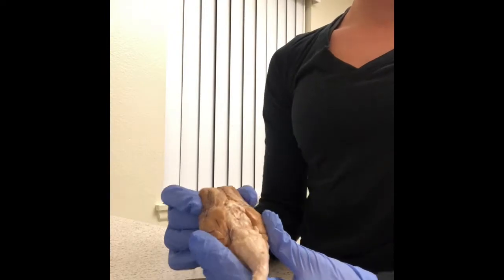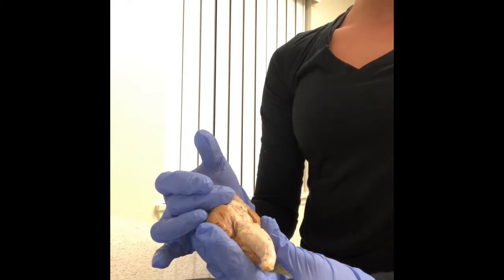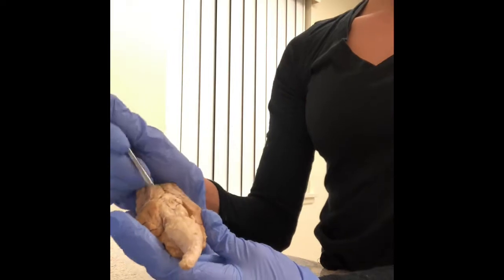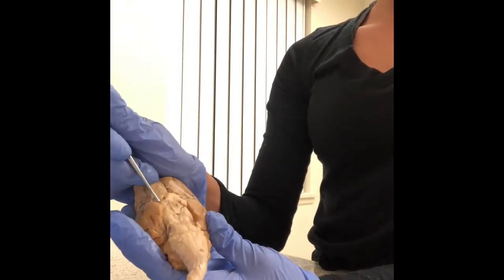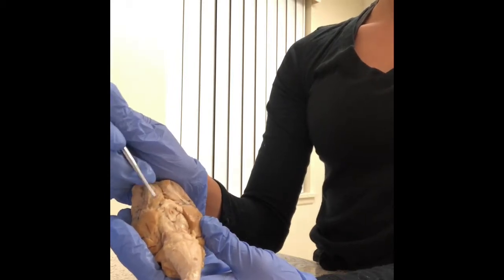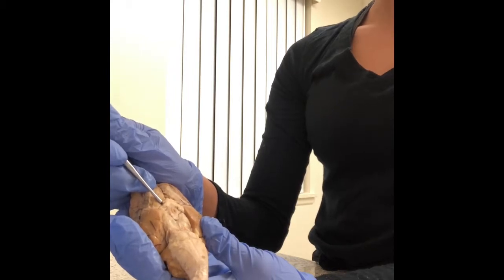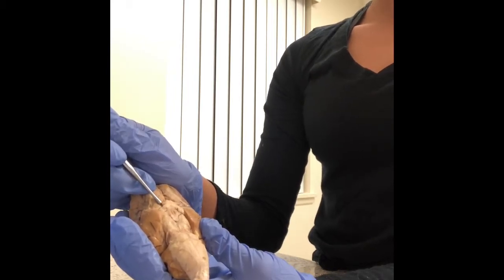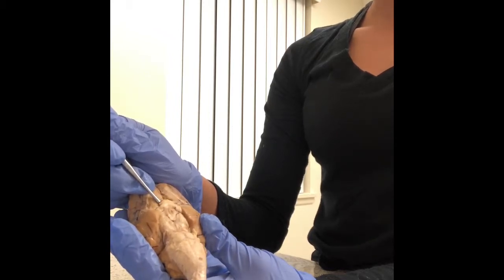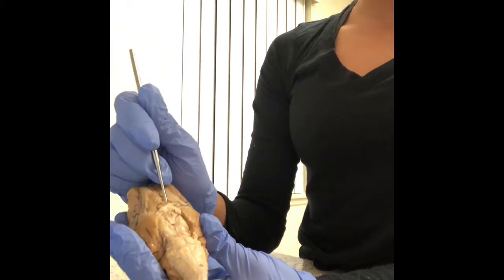We're going to be looking at the ventral view of the sheep brain right here, the ventral structures of the sheep's brain. We'll be starting out with the optic nerve. The optic nerve is right here, and it is in the back of the eye. The job of the optic nerve is to transfer visual information from the retina to the vision centers of the brain. It conveys visual information from the optic chiasma to the lateral geniculate nuclei. And then we have the optic tract, which is right here.